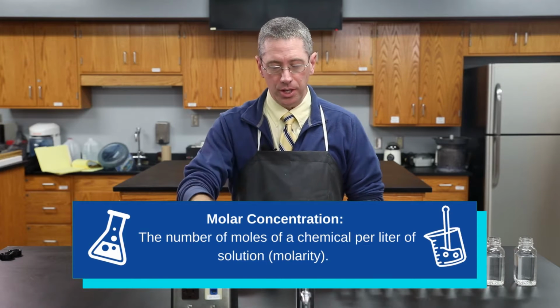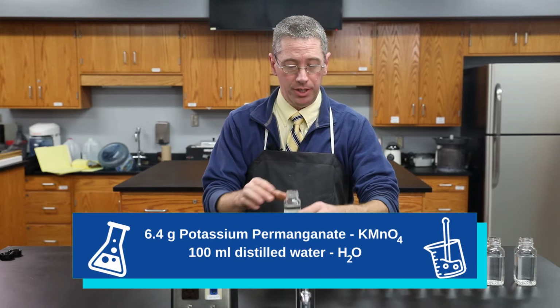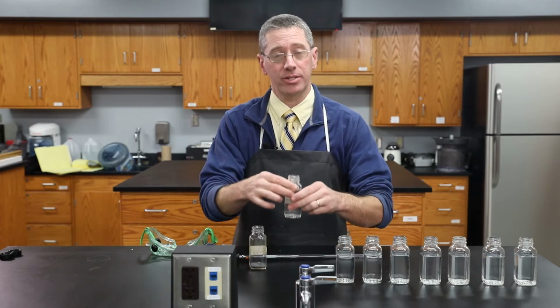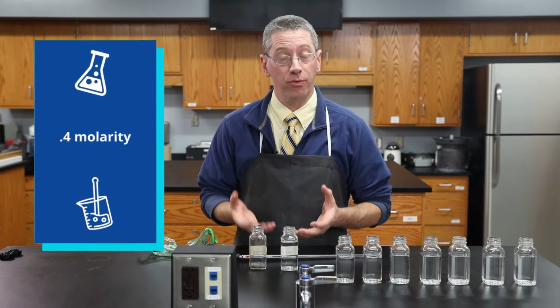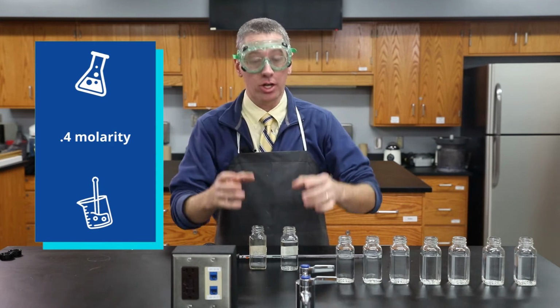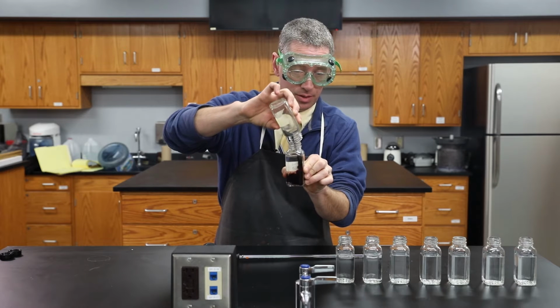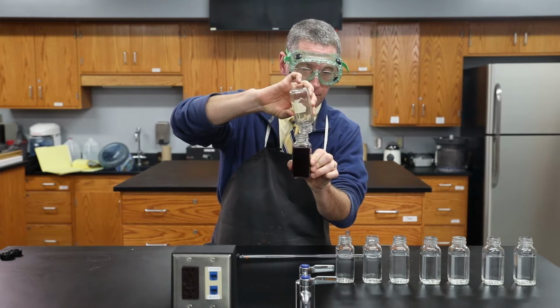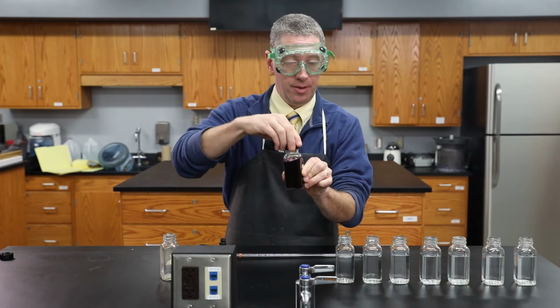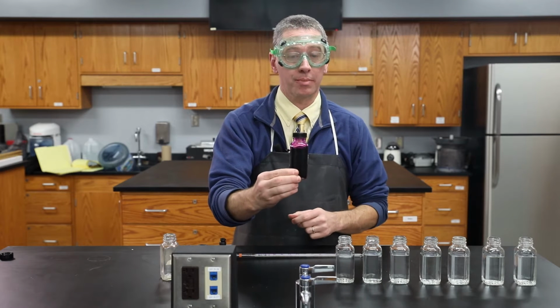So we're going to use 6.4 grams of potassium permanganate, and we're going to put it into 1/10 of a liter, or 100 milliliters of distilled water. And that's going to make a solution that is 0.4 molarity. The potassium permanganate makes a very colorful solution. Very dark purple solution. And at 0.4 molarity, it's so dark that it almost looks black.